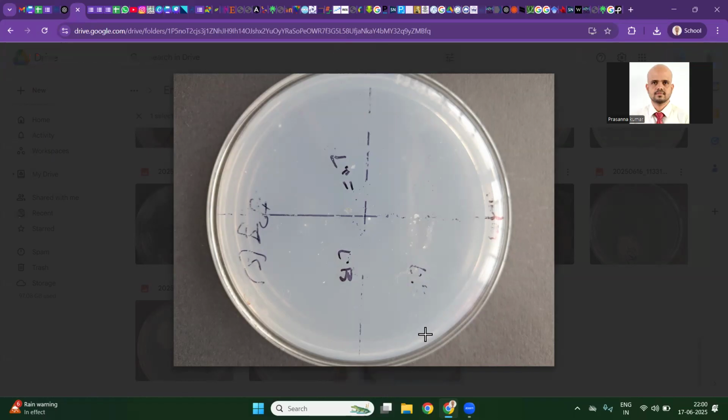So how are we examining our plates? I'm actually showing you the imprint plates. I will sequentially show you other imprint plates also. We are going to look for a clean laminar control, a clean imprint plate, then the growth around the explant of the inoculated plate. That's the gold standard you are going to use to authorize that any microorganism coming from the plant biomass is actually an endophyte.